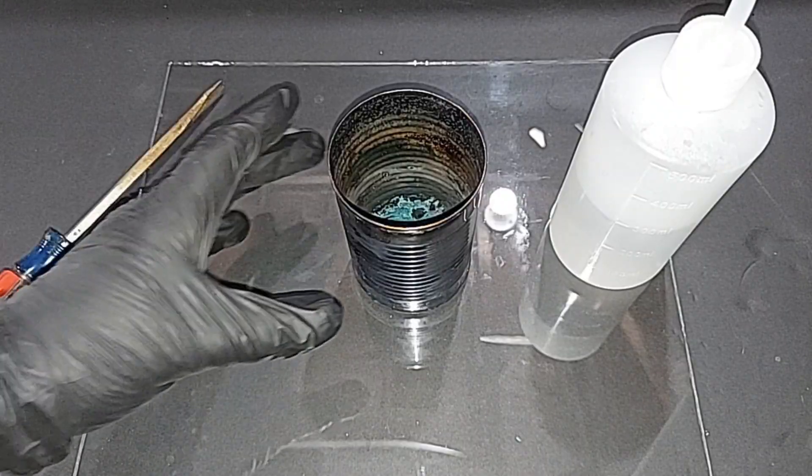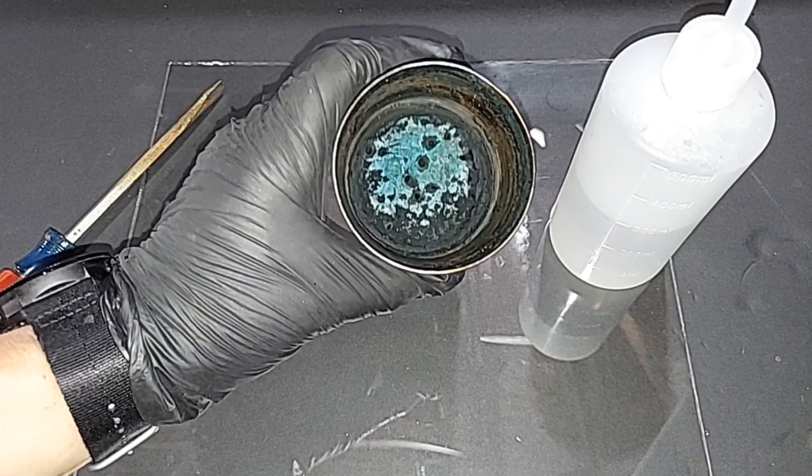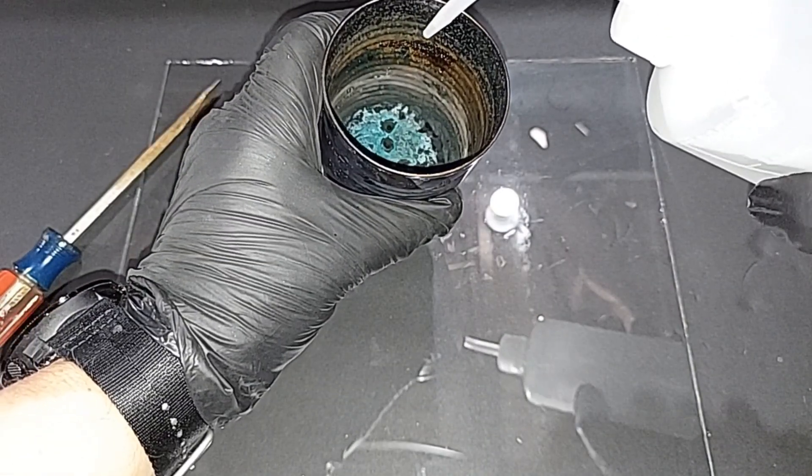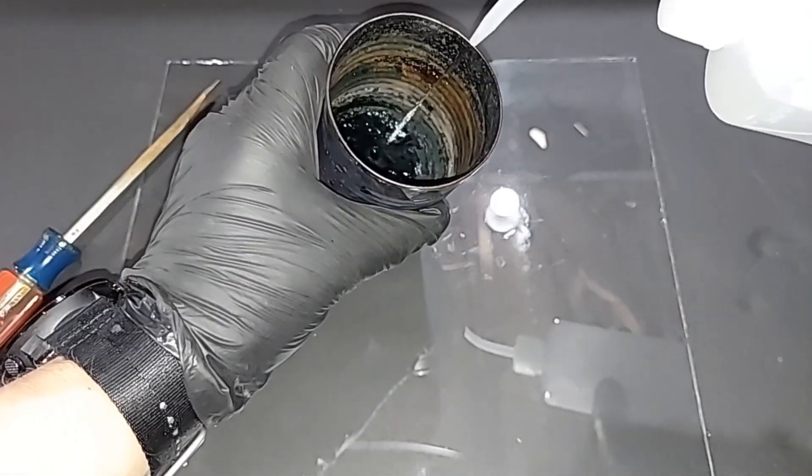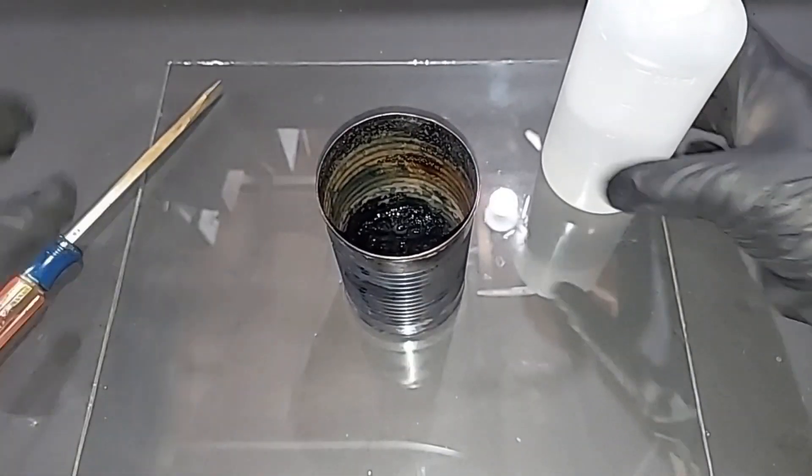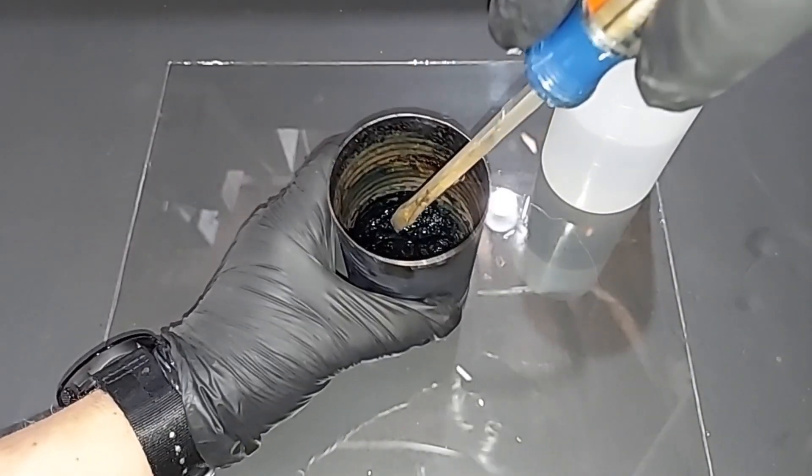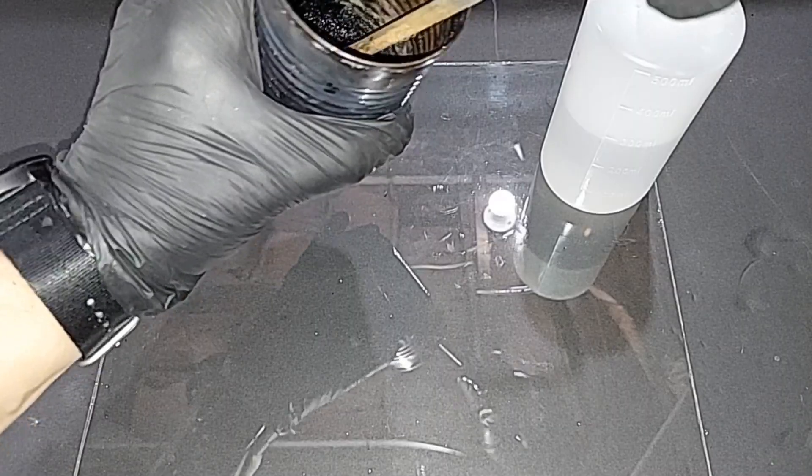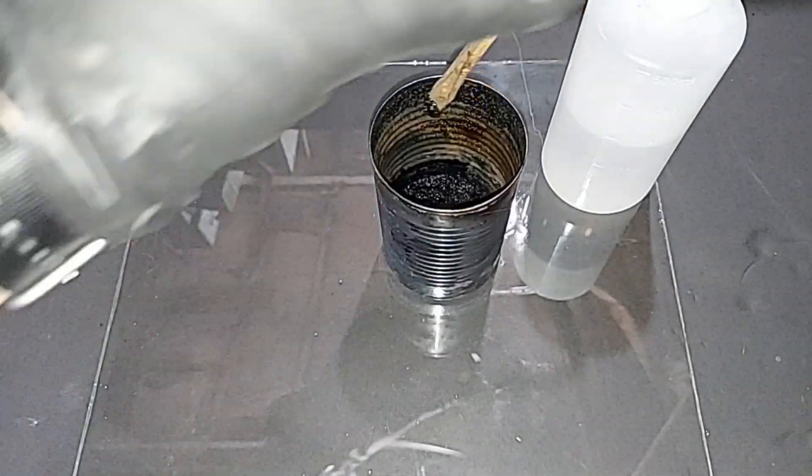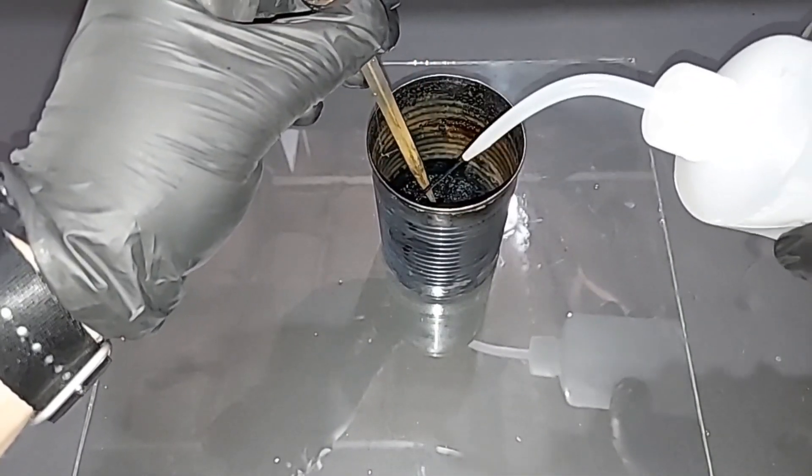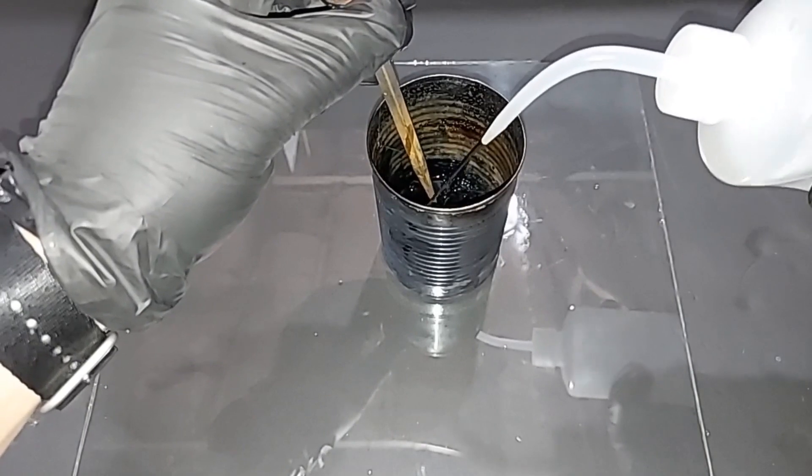This has been cooling for around five hours, much longer than it really needed, but it is definitely cool. I'm going to now add the distilled water. You don't want to add too much because you just have to get rid of it later, but just enough to break this up. I have a screwdriver here to assist me. That stuff is really hard, man.